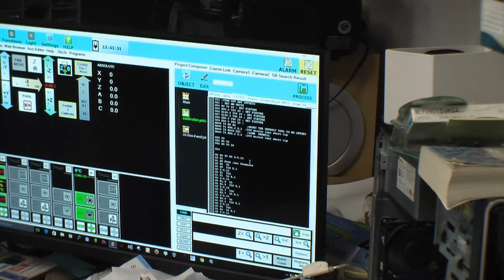Got the minus correct, and in this case we're going to go to a plus number, so let's go to 5. Minus 5. Z minus 5, so that's minus 5 millimeters. Alright, and I move it to set the feed rate back, and we're already at G0, X0, that is really redundant. All these G0, Z moves can go away.